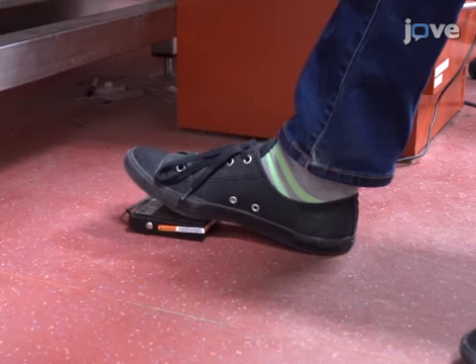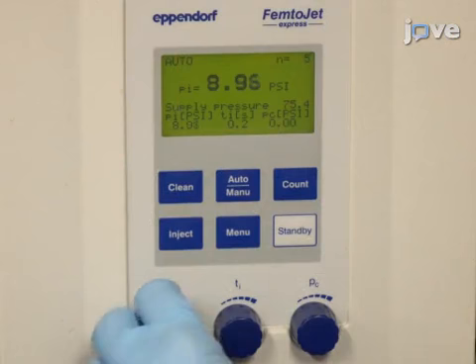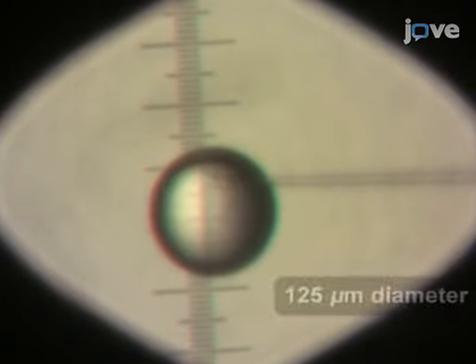Measure the injection volume by pressing the foot pedal and adjust the gas pressure and/or duration time until the injection volume is equivalent to 1 nanoliter as measured with the micrometer slide or alternatively with the eyepiece graticule.